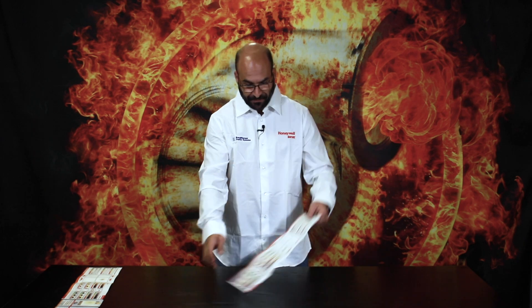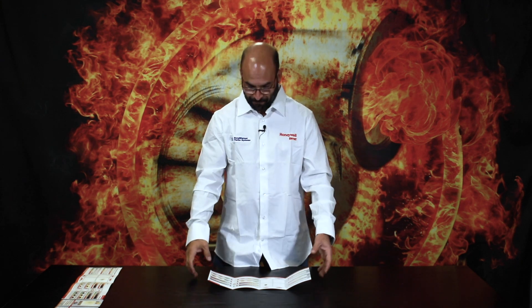What we basically do is we have this card — which I'll show you close-ups of in a moment — which has four different oil tests, or four pads, that we can do individual oil tests on. The pads have a reactive chemical on them which reacts to water or fuel, whether it be diesel, petrol, or whatever the case might be. It'll discolor into different shades and colors, giving you an idea of exactly what the oil contains in terms of deposits, fuel dilution, or water dilution.